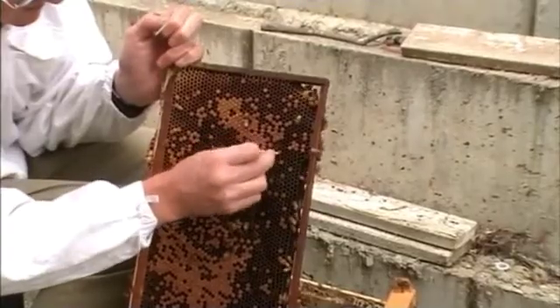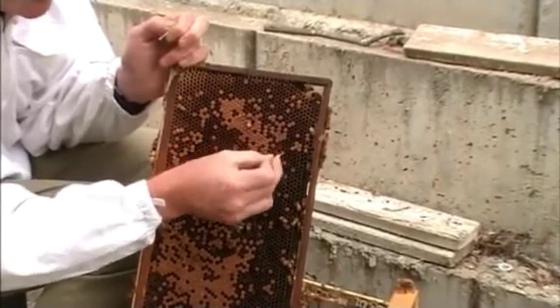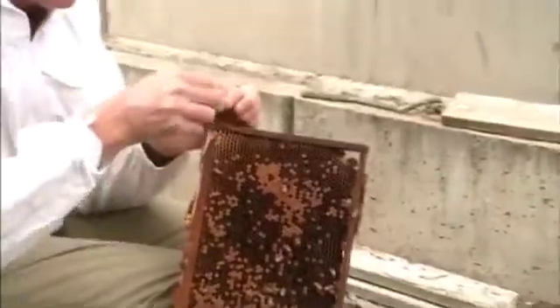So you say glass slide — where do you get those from? From a chemist, veterinary supplier, or any number of places on the internet these days.